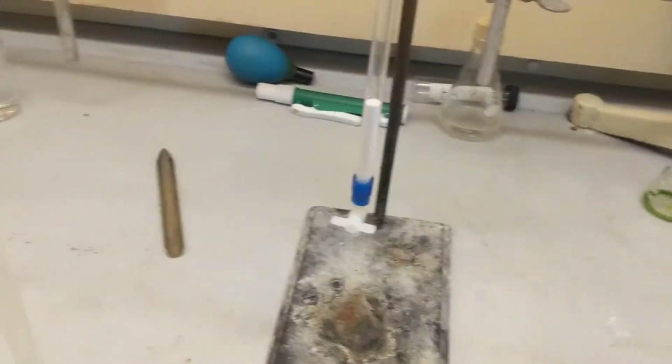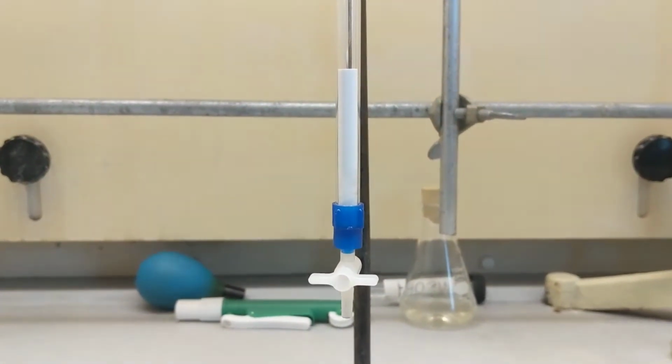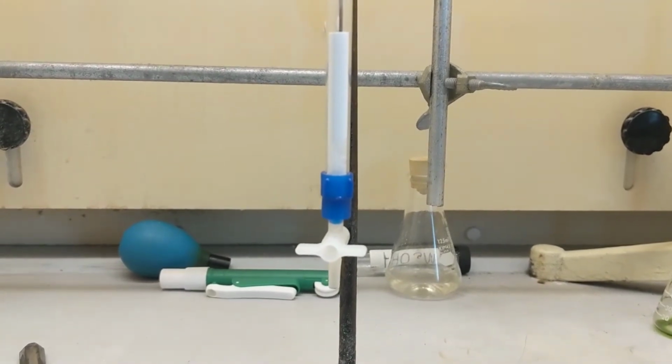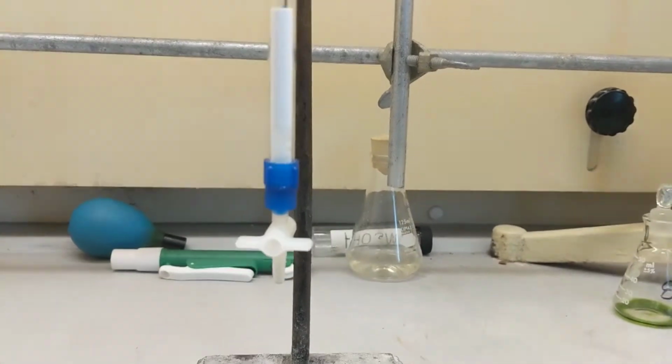Hey guys, alright, this is part B. As you can see, I've set up my column. I would have shown you guys how to do it, but I hated doing it, and they would have been made for you anyway, so I didn't. Trust me, you didn't miss anything.